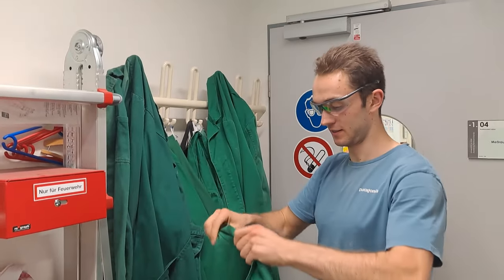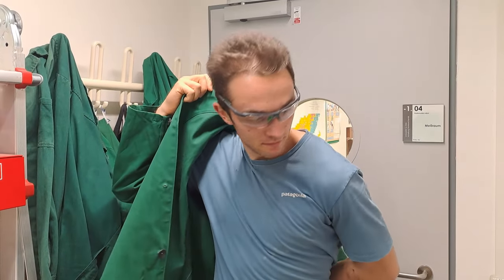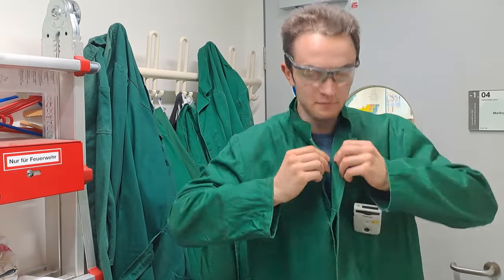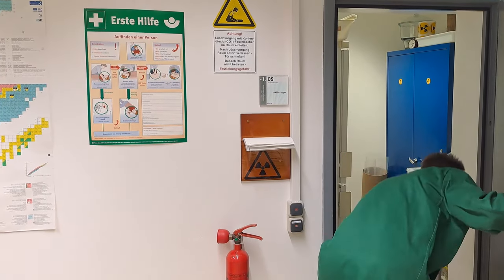But before we start working with uranium ore, some safety precautions need to be taken. As always, you should measure yourself for radioactive contamination beforehand and then put on the green lab coat from the nuclear chemistry and also wear your dosimeter.